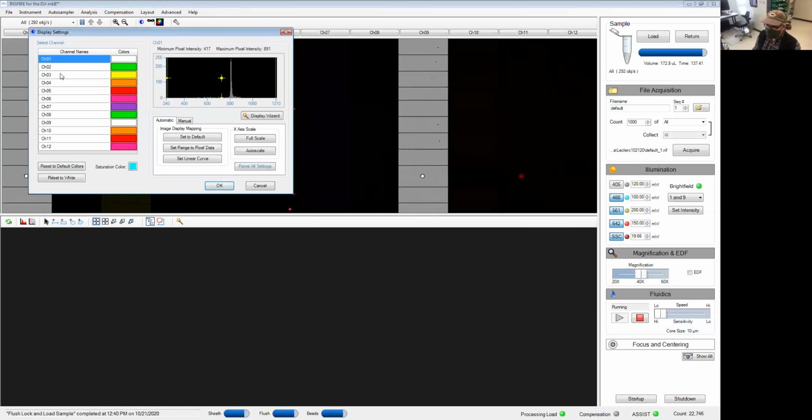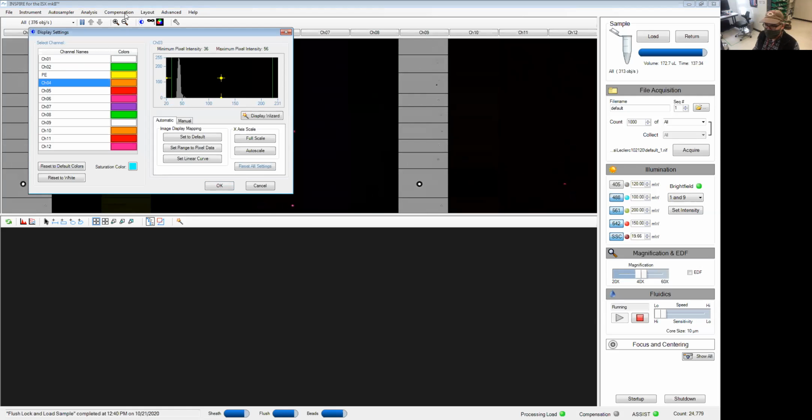The other thing I can do here is change the name of my parameter. So channel 3 happens to be the channel we're going to use to look at PE. Channel 11 will be for APC.